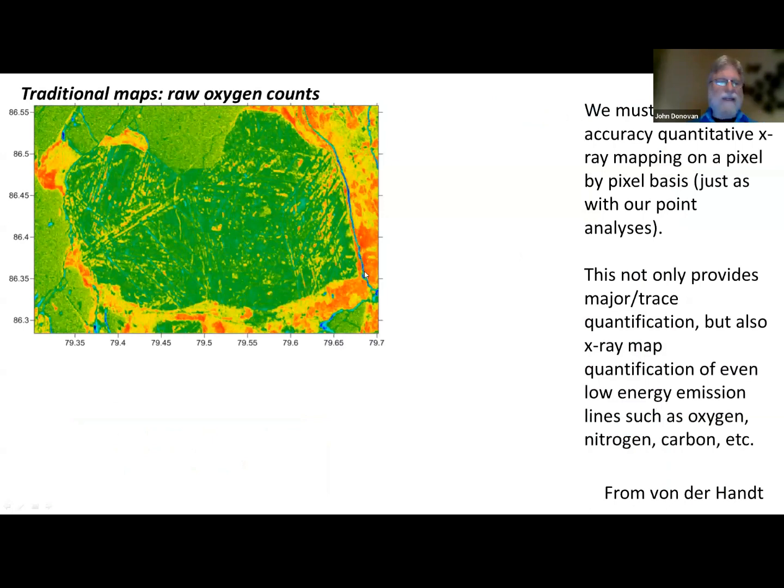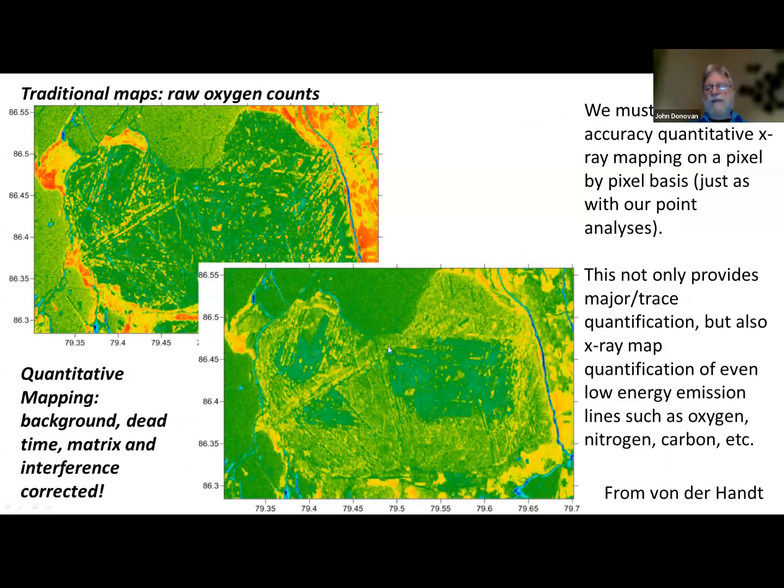So here's a map from Annette, and this is a raw oxygen map. If we gaze at this map, because we're map viewing, like moon viewing, we would come to some conclusions about where the oxygen is in this iron titanium oxide. And we would be wrong, because if we quantify that map, we get a very different story. So the point is that seeing is not believing if you're not being quantitative. All right. So we need to correct all these pixels for the background, the dead time, the matrix, and the interferences involved. And as I will show you, even for volatile ion migration effects as well.